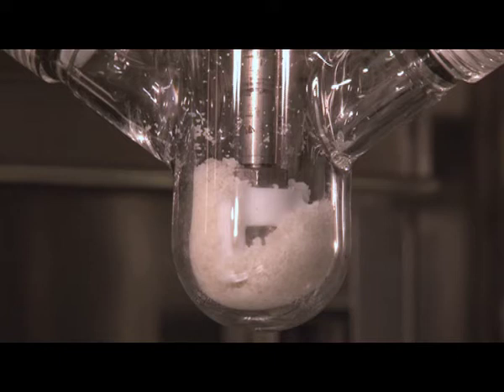The P-SIL shown in the reaction chamber is a solid at 40 degrees Celsius. The clock will show the elapsed time on the bottom left as the video has been accelerated for brevity.